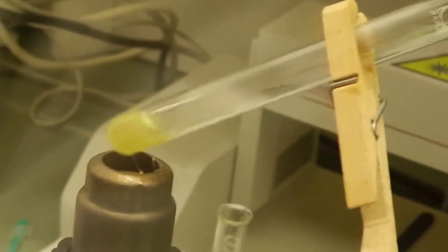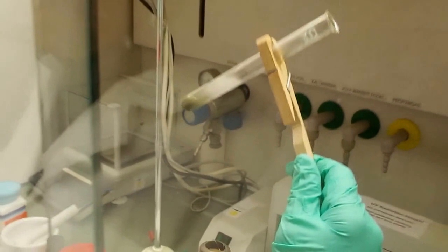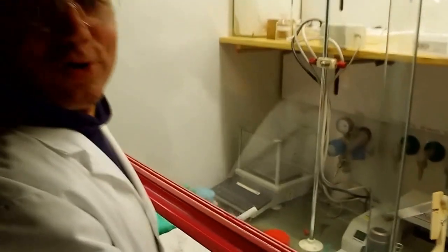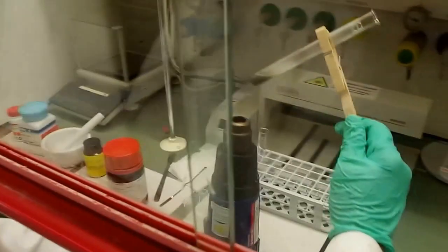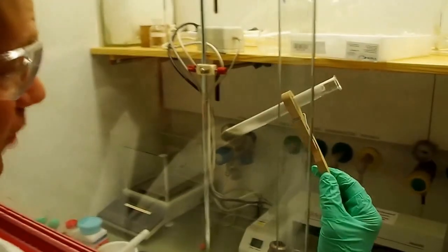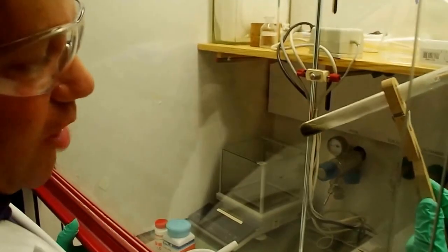Oh my God, what happens? Of course, we forgot to control the temperature. Sure. Okay, sorry guys, that's the same thing like you cook and you burn your meat. I'm really sorry for this, but honestly, I planned this joke, because I want to tell you something. You see this color? It's like gray black.